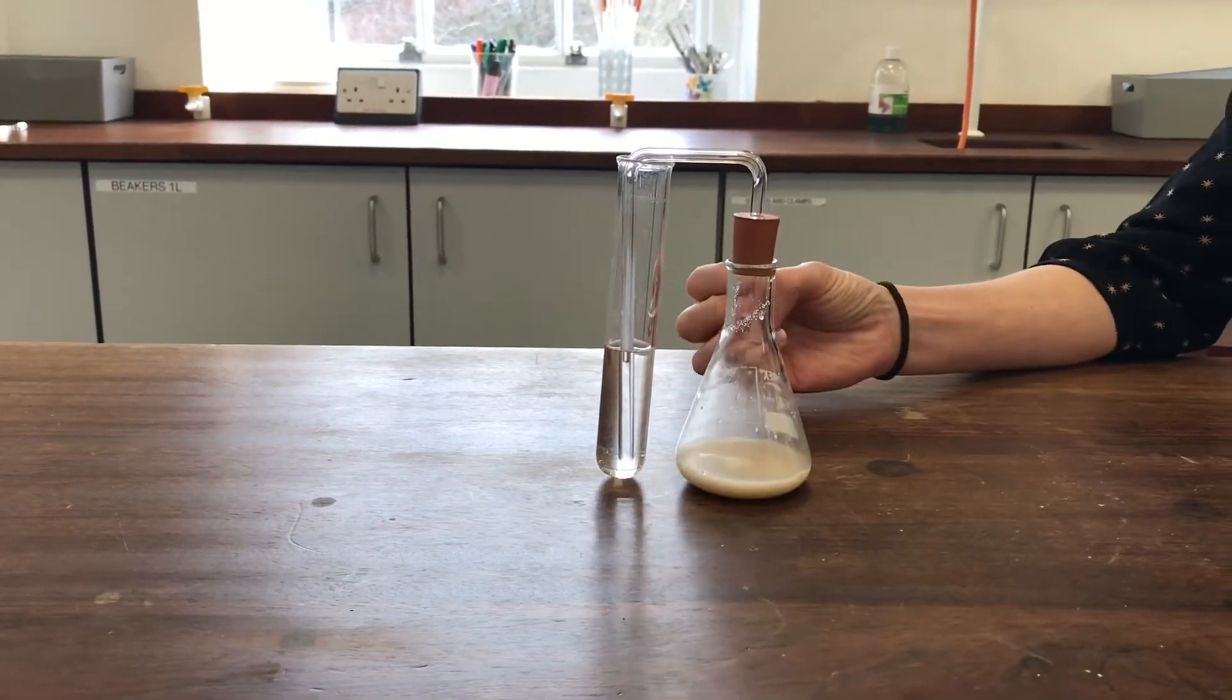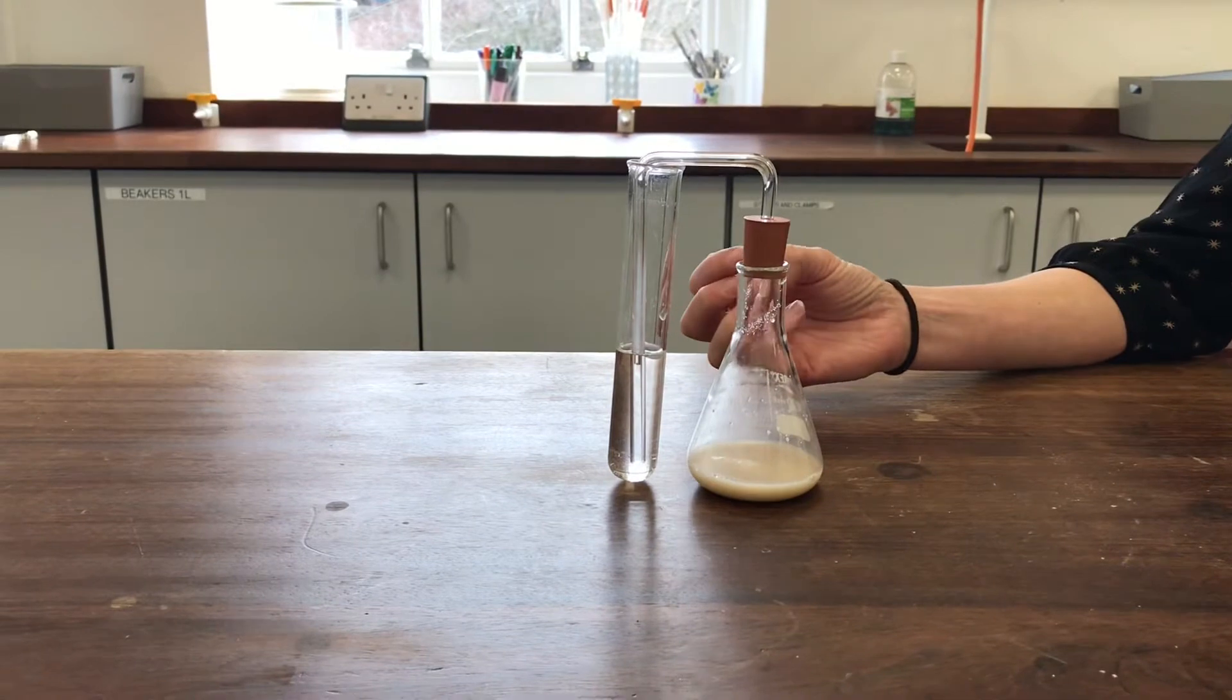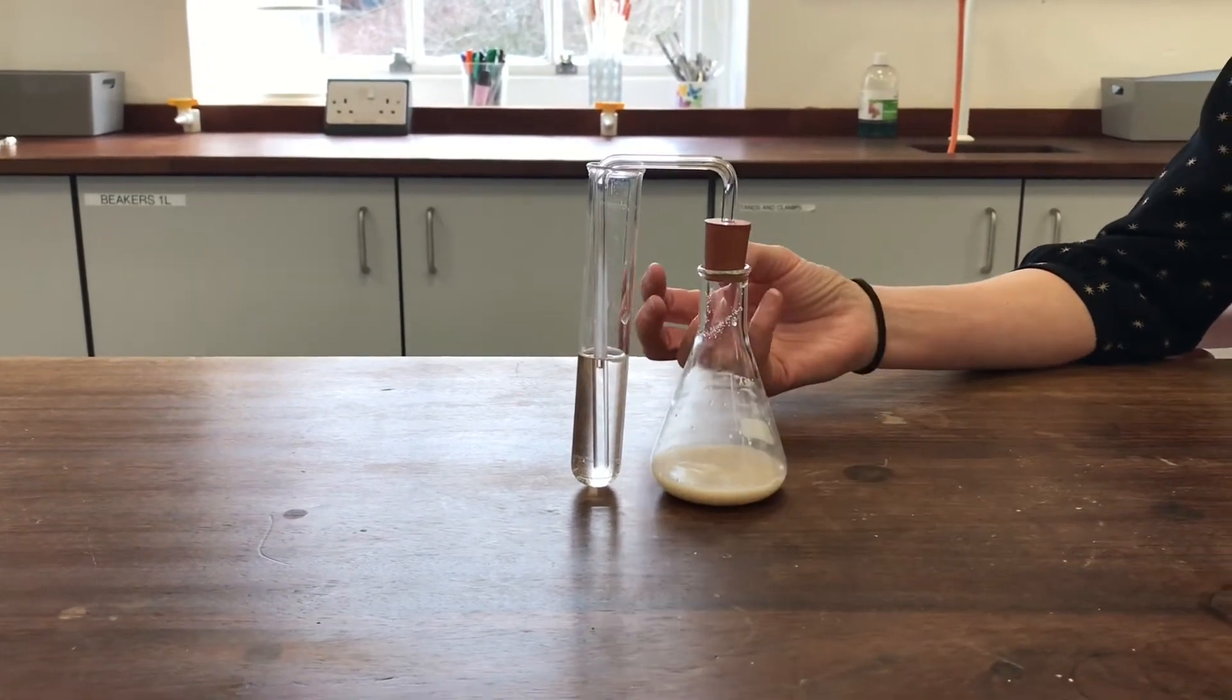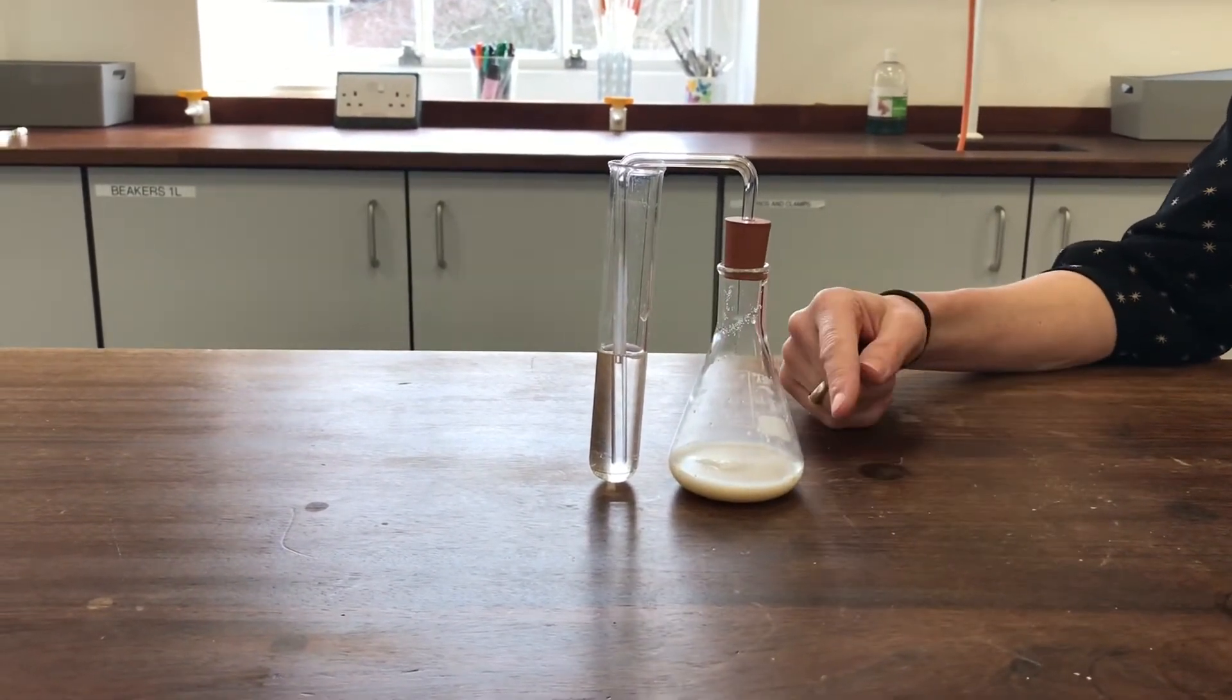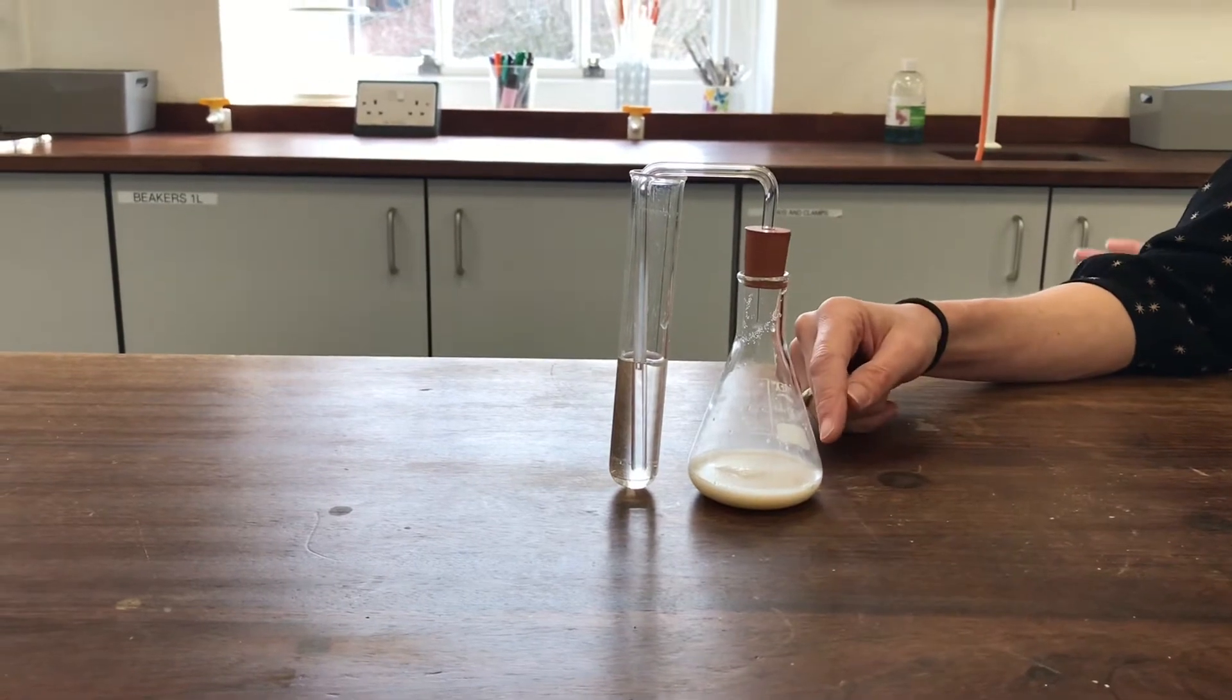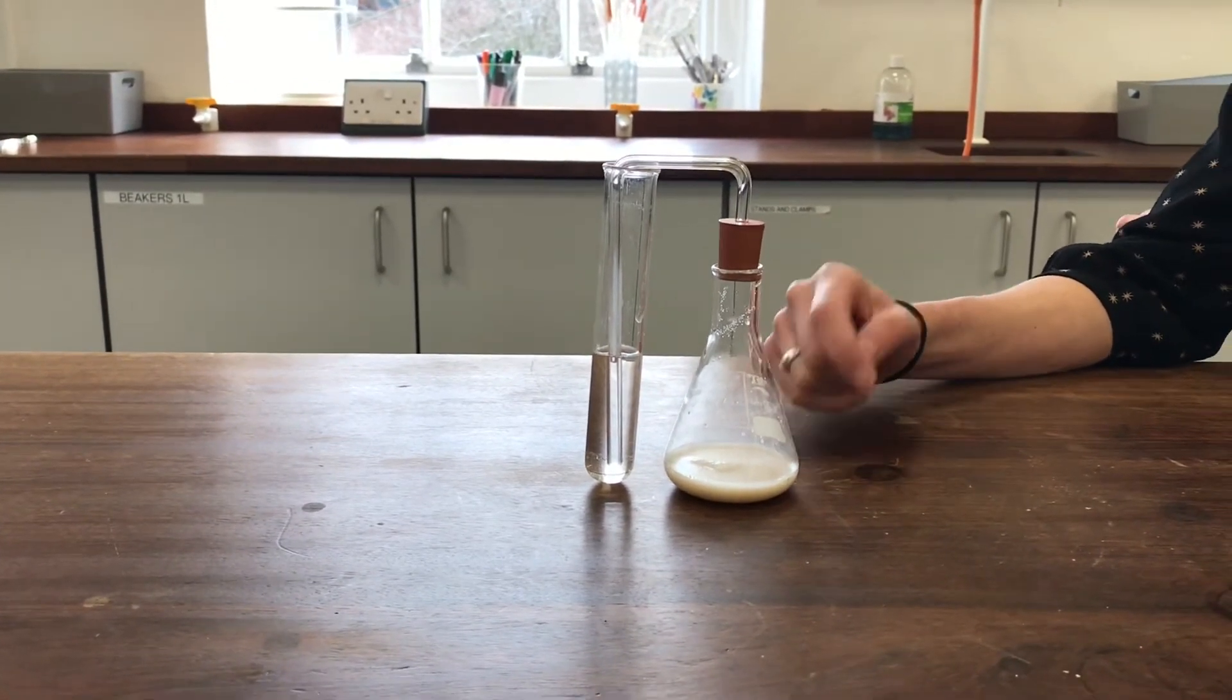aerobically respiring in order to produce CO2 and water. And eventually, as the oxygen gets used up in this flask, it will start anaerobically respiring and it will produce ethanol and CO2.